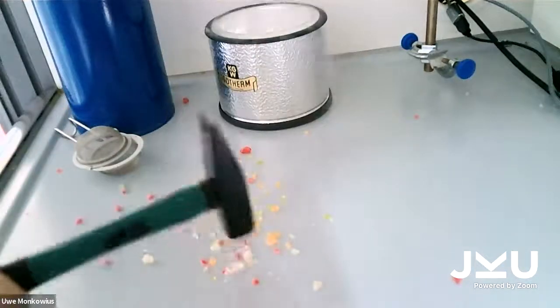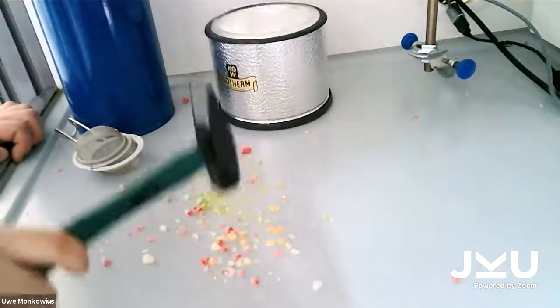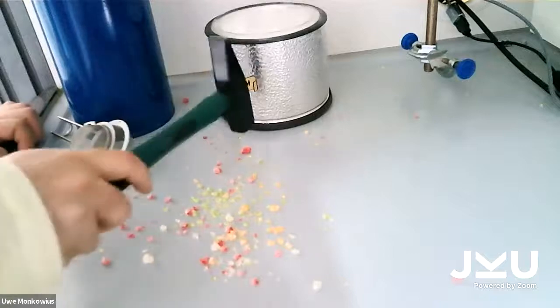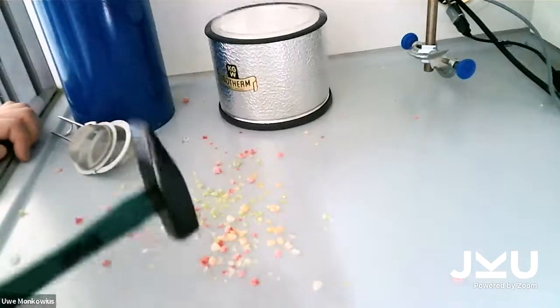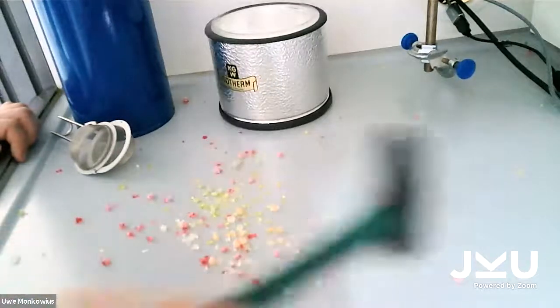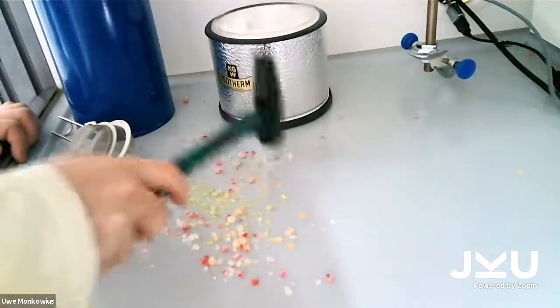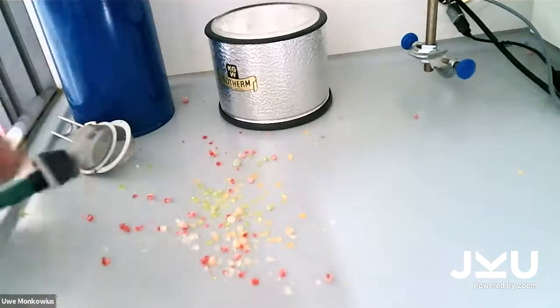Yeah, okay. So here, the reason is mainly not the sugar. It is the sugar too, but it's mainly the water that's really frozen stiff. All other material also gets really brittle when it's really cold. We could also do the same experiment with, for example, flowers or other living tissue. With my finger, for example, but I won't do that.